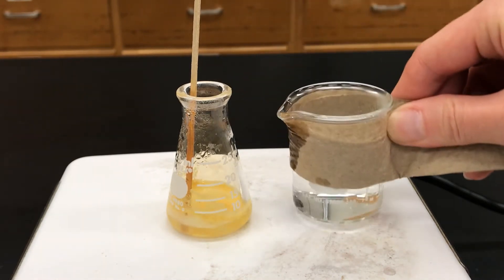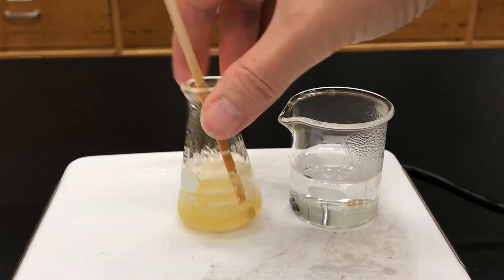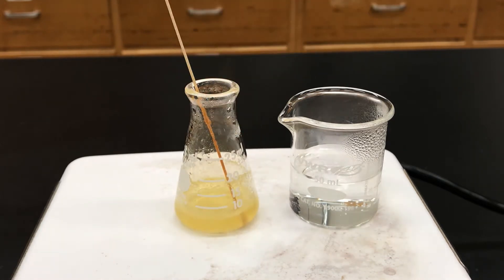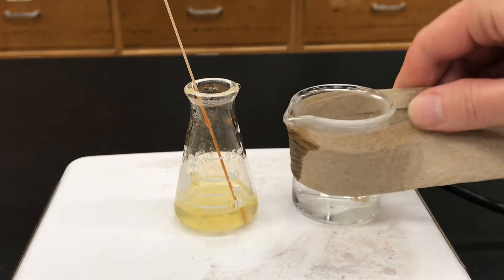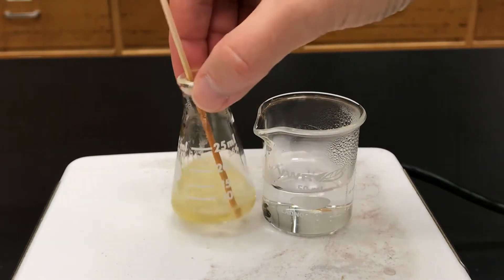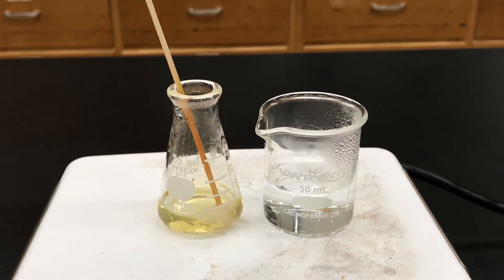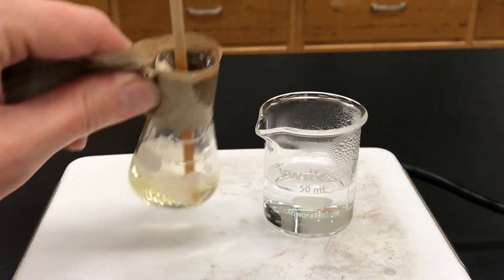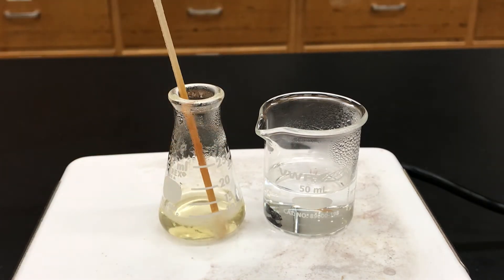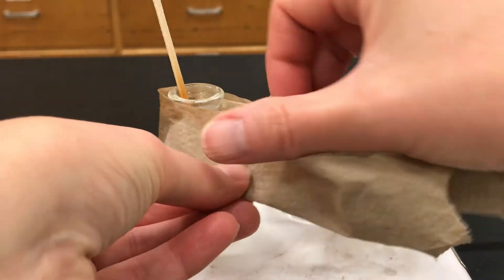Let's add a little bit more. We want the minimum amount of solvent to reduce the amount that will eventually be lost in the solution. I see little hints of solid still on the sides, so I'll add another portion and give it another swirl, rinsing the sides. At this point it looks pretty good — it's completely clarified and I don't see any more solid, so I'm going to say that's done. Do you see how all the solid has been dissolved?